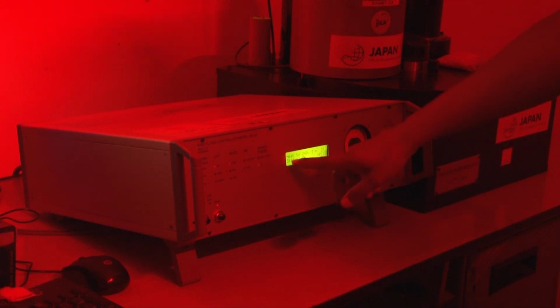Here you can see the system is down and the nitrogen flow is on, and here you can see it is paused for 5 seconds and then it will lift the rising lift. That means your aliquot has been lifted by the knob which is provided over here, and you can see that it will heat the sample up to 240 degrees Celsius.